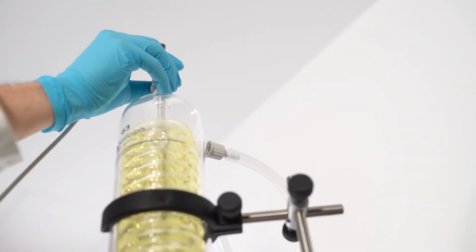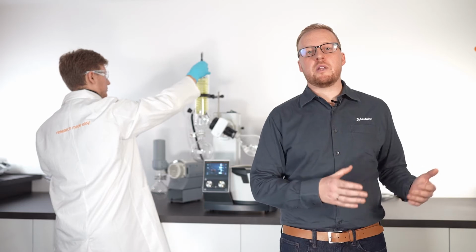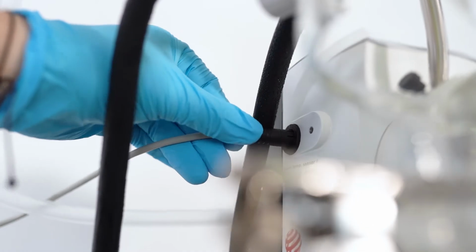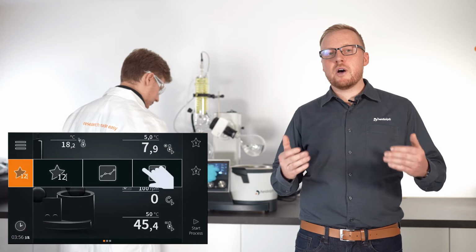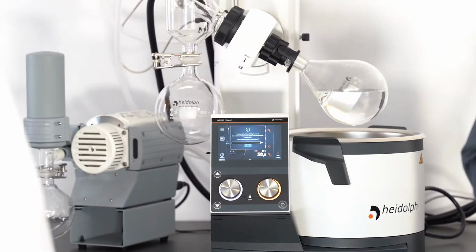You can connect the AUTOaccurate sensor, which is an optional accessory, to your Hei-VAP Expert or Ultimate control unit. The system will recognize the sensor automatically and will allow you to start the so-called dynamic AUTOaccurate evaporation. The first and most important change on the display is that you won't see the set vacuum anymore, as the program automatically searches for the right vacuum level, so you do not need to know the right parameter. The system will do the job for you.